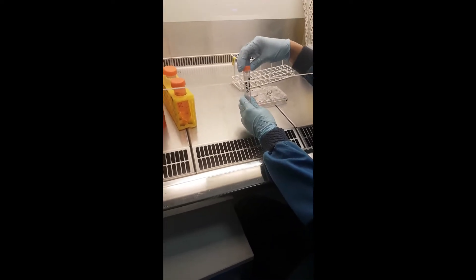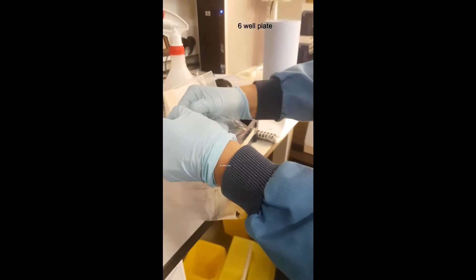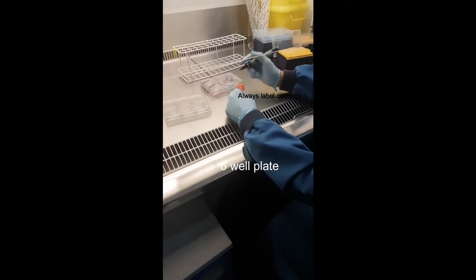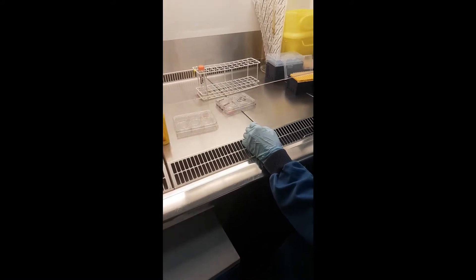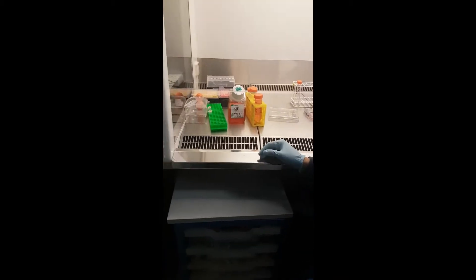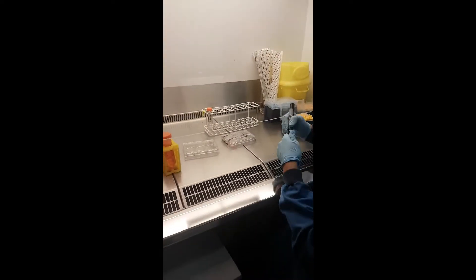Slightly pre-open the tubes before starting — just not completely, just slightly — it makes things easier. We also need a new six-well plate. Make sure whatever culture you have is correctly labeled. For the stocks, try not to open them too much — you can just put them like this, and then later tape it and put it back.